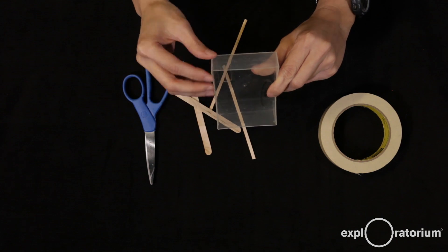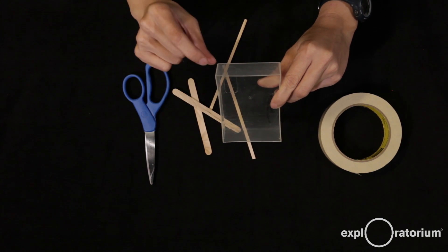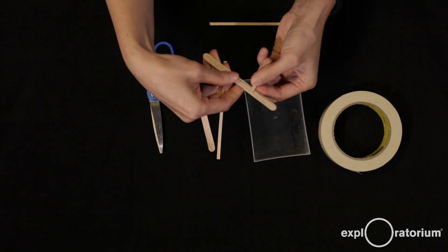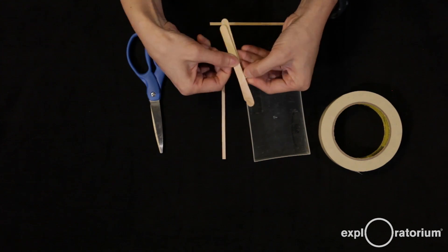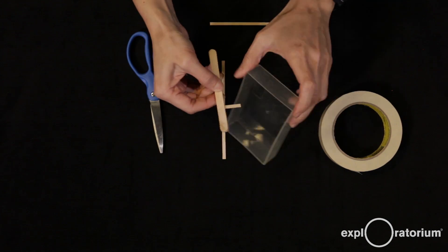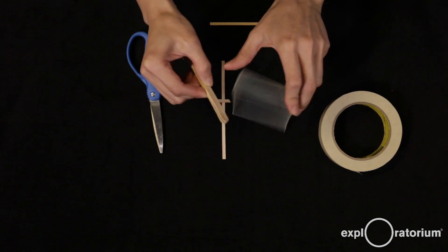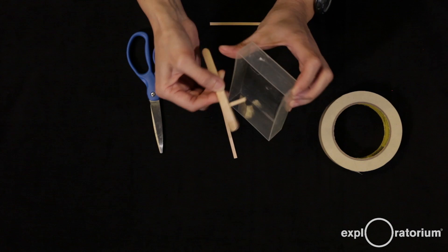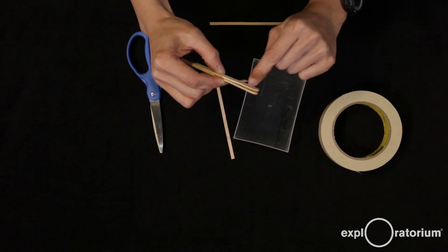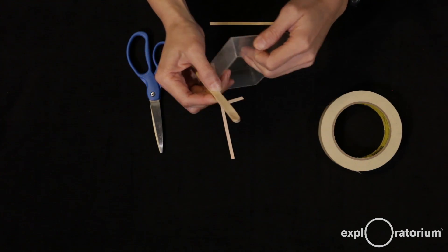We're going to pour a liquid gel and it's going to set. When we remove the comb, it's going to leave empty spaces that serve as wells. I'm just going to cut the coffee stirrers with some scissors. The larger popsicle sticks will serve as the bread in a sandwich that wedges the teeth in between. I'm going to measure how long that coffee stirrer needs to be by looking at my box — I only want a small gap between the bottom of the tooth and the bottom of my box.